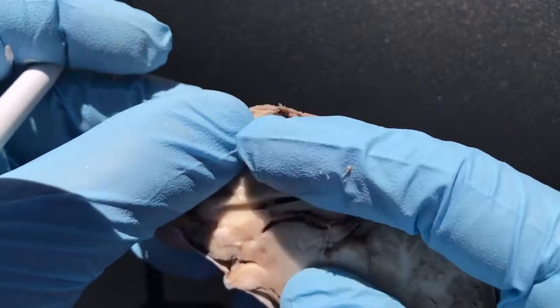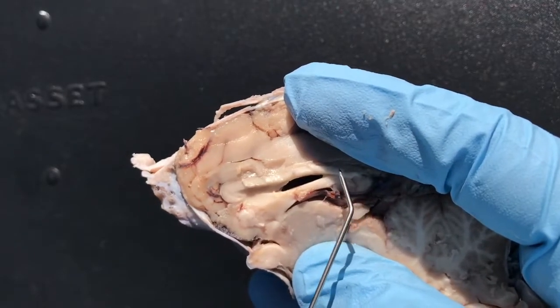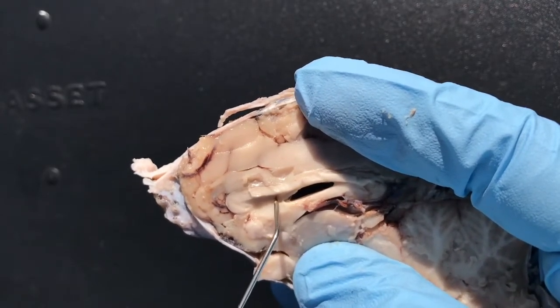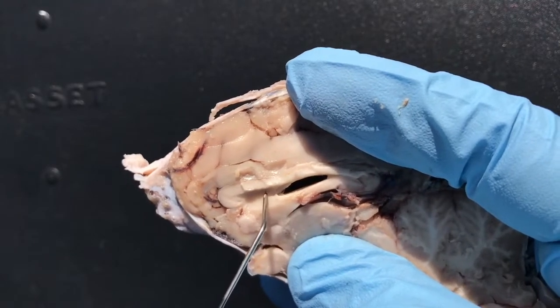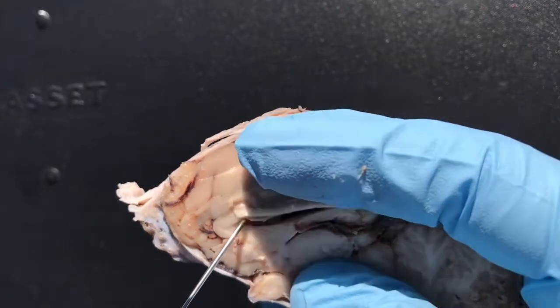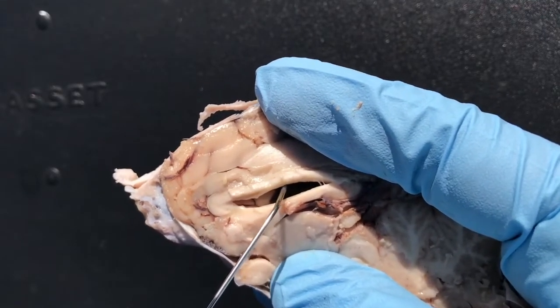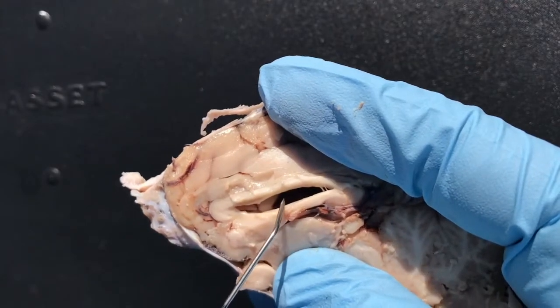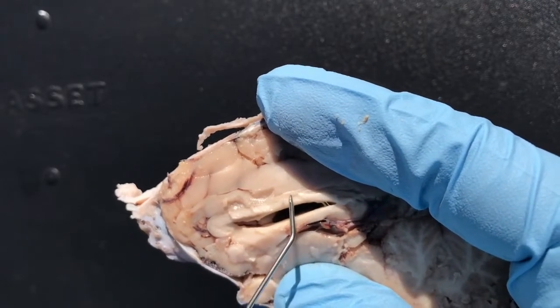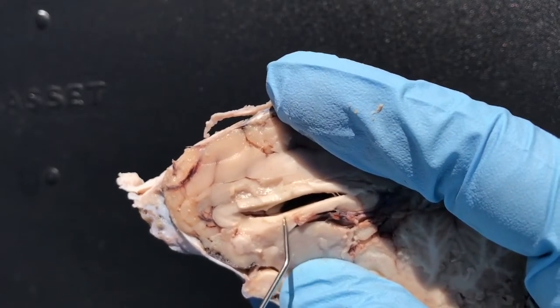I'll kind of open up, and you can see here is the corpus callosum. This white right here that you see is the corpus callosum. And I kind of tore it. There's a membrane right here holding in CSF — this is the septum pellucidum. However, if I sort of just make this incision here, now we're looking into the lateral ventricle. The first two ventricles would be the left and right lateral ventricles. And this is the corpus callosum. The inferior border here is the fornix.